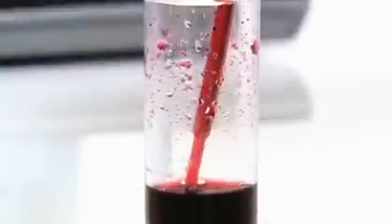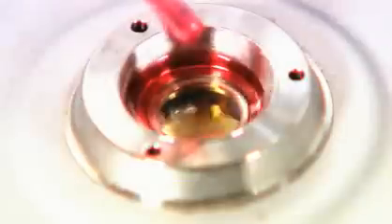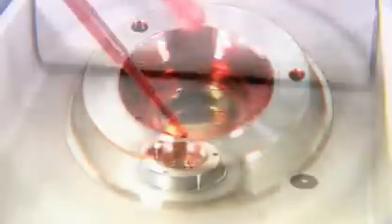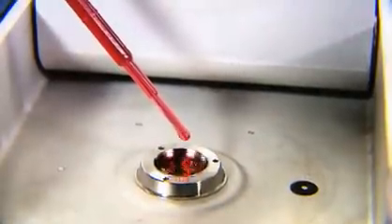Then take a little more of the same sample and put a drop into the small sample cup on the standard module. Lower the lid immediately in a smooth, continuous motion.